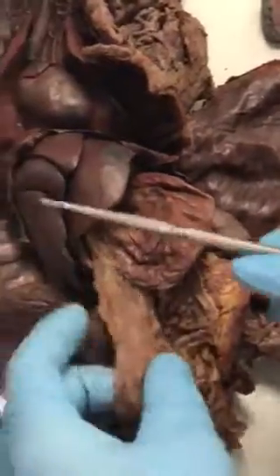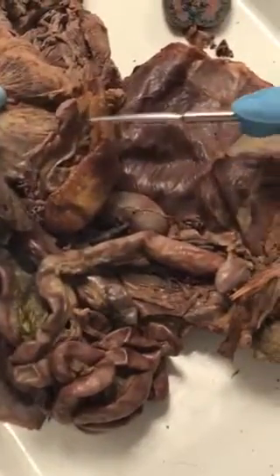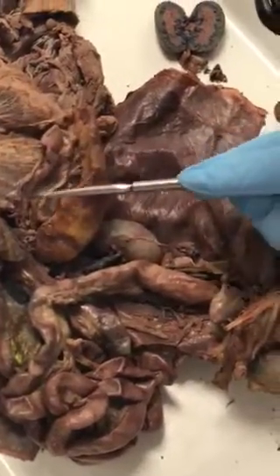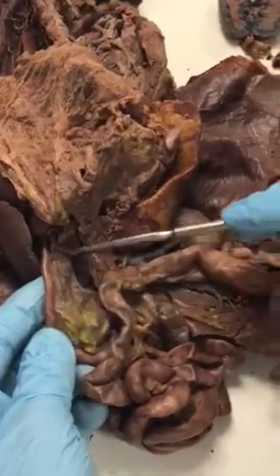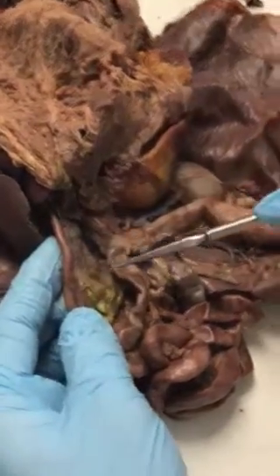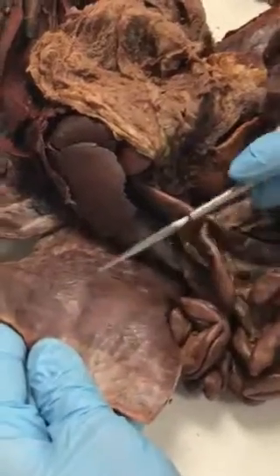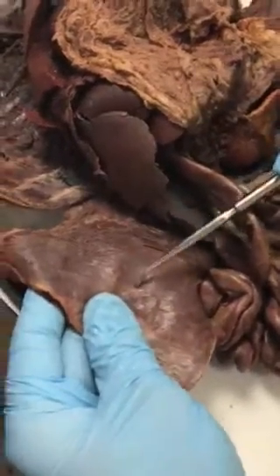And then if we flip over our greater omentum, we will see this kind of string-like linear structure going along here and then attaching up with our duodenum. And this is our pancreas right here. That's our pancreas. Looking on the outsides, we've got this skin flap, this shiny membrane, and that's called our parietal peritoneum.